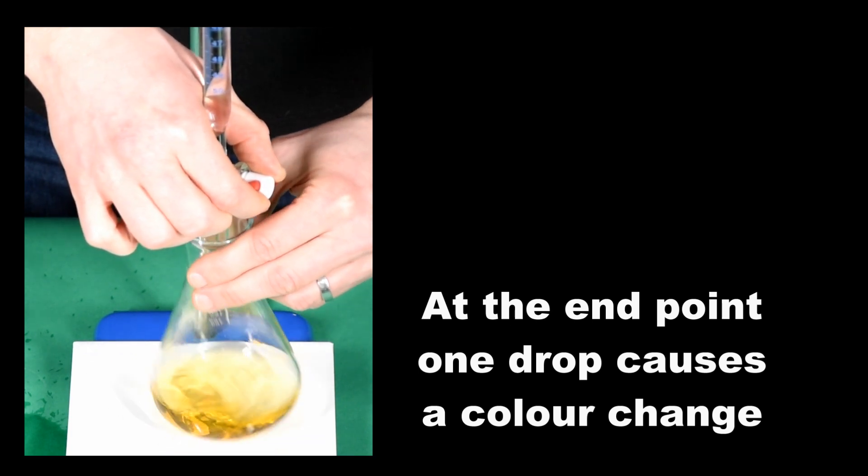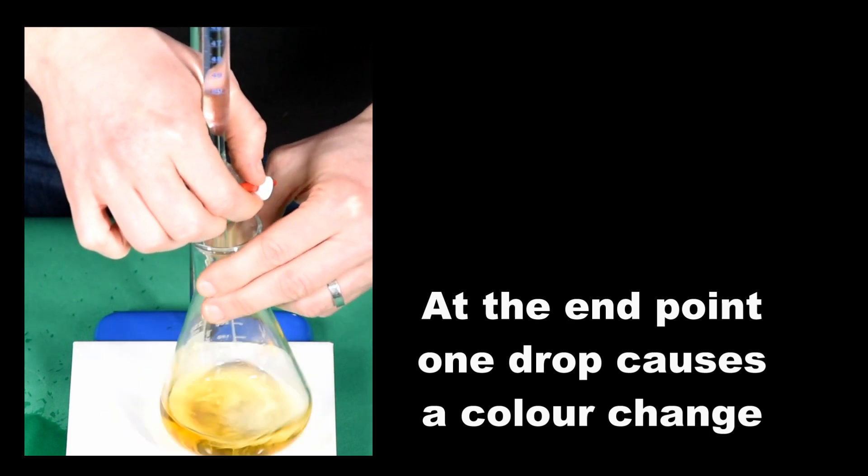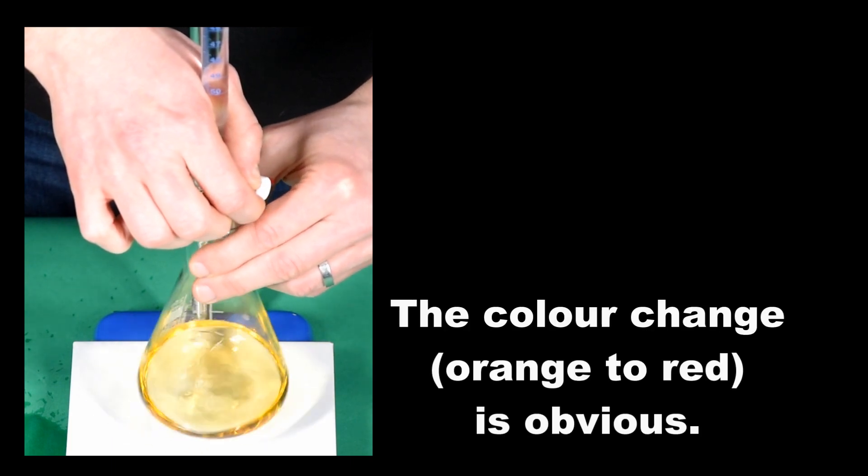At the end point, one single drop can cause a complete colour change. The expected colour change from orange to red is becoming increasingly obvious, and it takes more shaking to get it back to orange again.